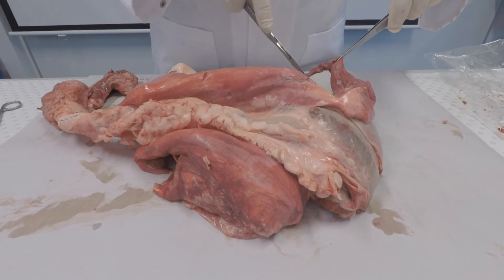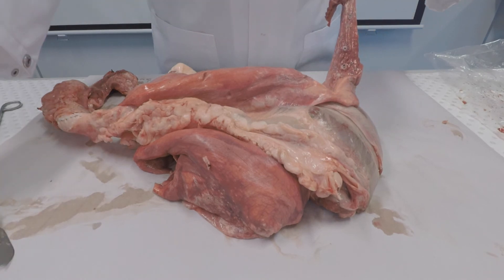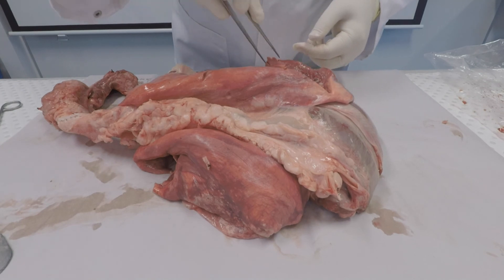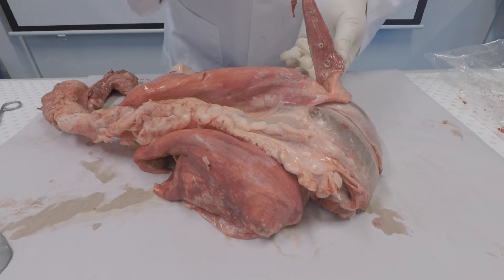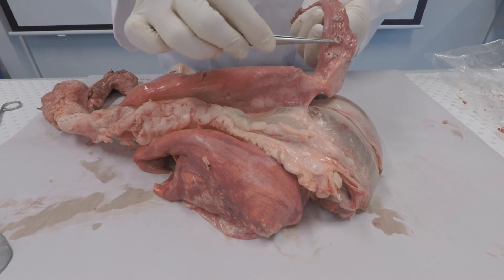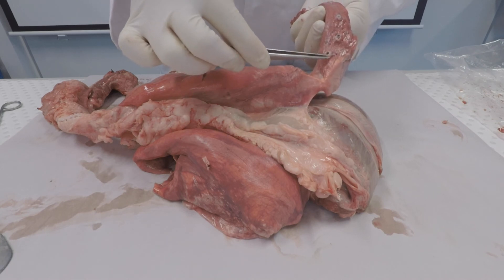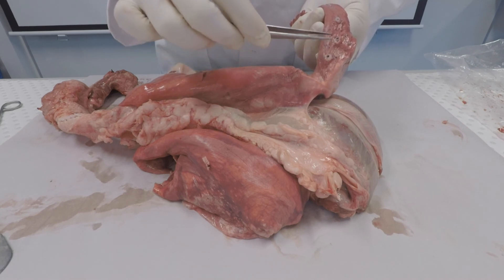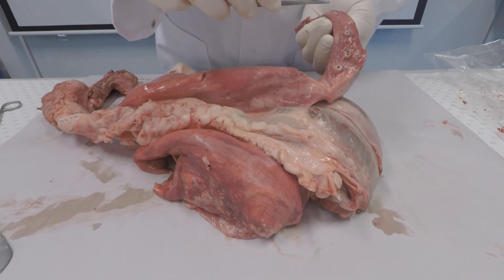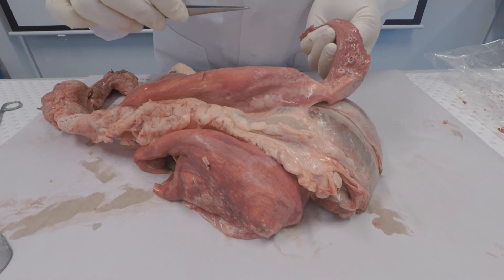And you can see some of the lighter structures in the lung tissue representing some of the bronchi that I'm pointing out now. The bronchioles will branch further and terminate in the alveoli.